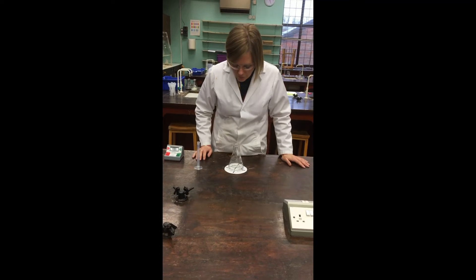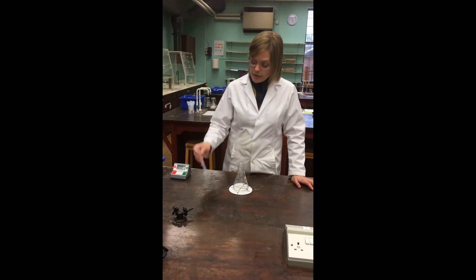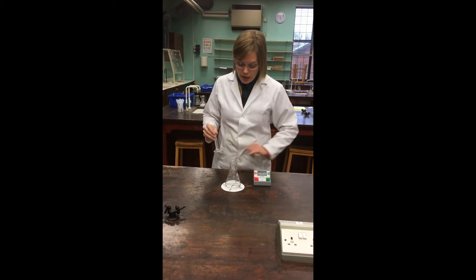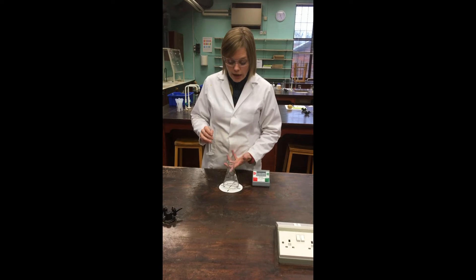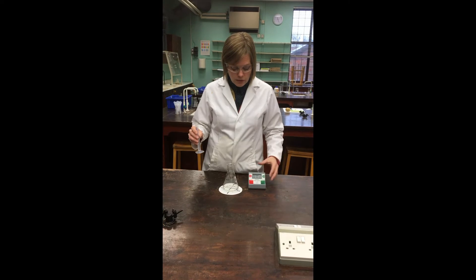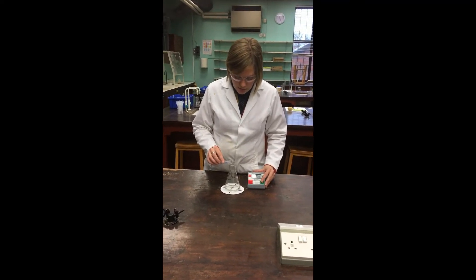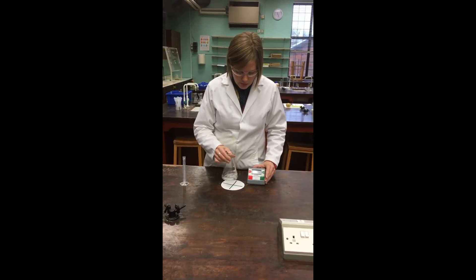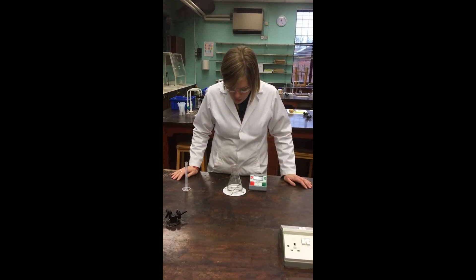If I look down now, I can see that cross through the solution really clearly because it's a clear colourless solution. I'm going to add this clear colourless hydrochloric acid solution to that, and then gradually, as this mixture begins to form that yellowy precipitate, it goes cloudy, which obscures the cross from view. This is the so-called disappearing cross method. I'll start the stopwatch as soon as I add the hydrochloric acid — adding it now, starting the stop clock, giving it a little swirl, standing it back on the cross, and watching and waiting.